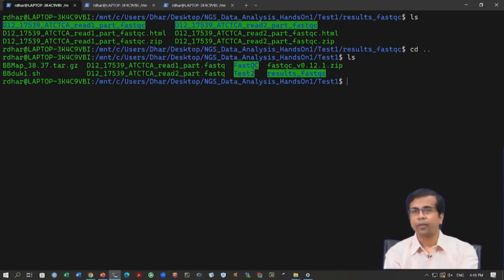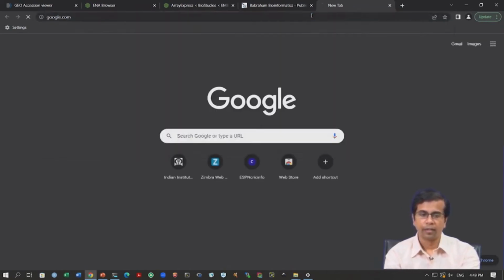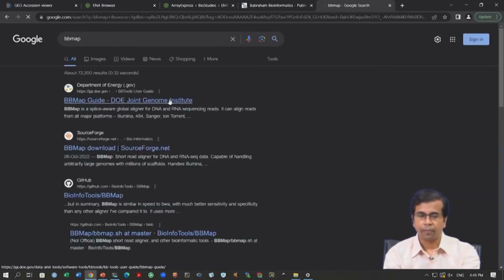Okay. So, for trimming we have discussed many tools, right. If you remember, we have discussed at least 3 tools. I have given you the link, but today we are going to use one tool, which is BBDuk. Okay. So, BBDuk is a tool that utilizes some of this information about the adapters to remove this from the read data. Okay. So, we can actually set up BBDuk, right. We can simply say BBMap. This is actually a package, right, that contains this function BBDuk.